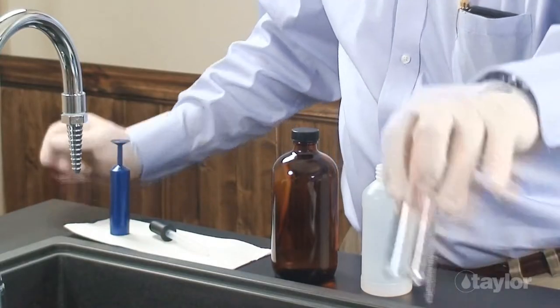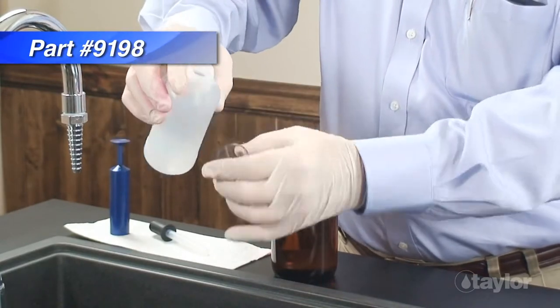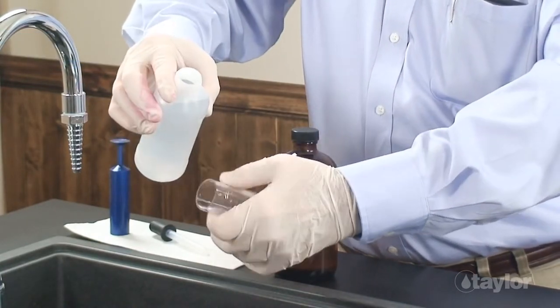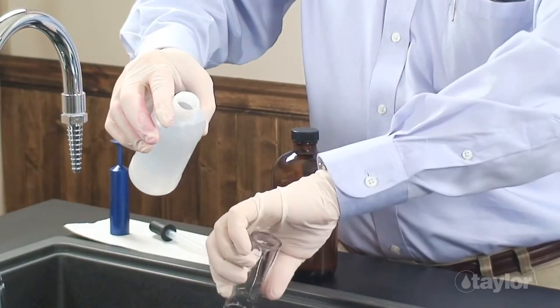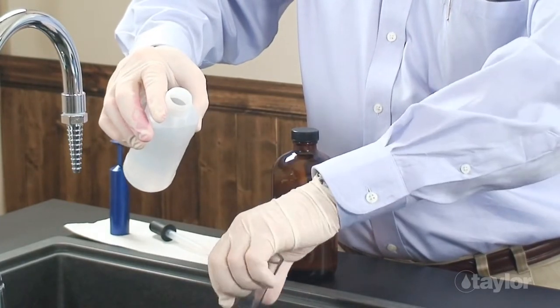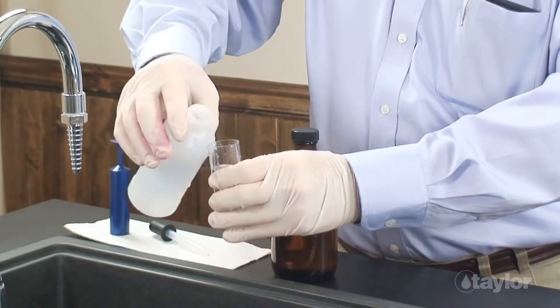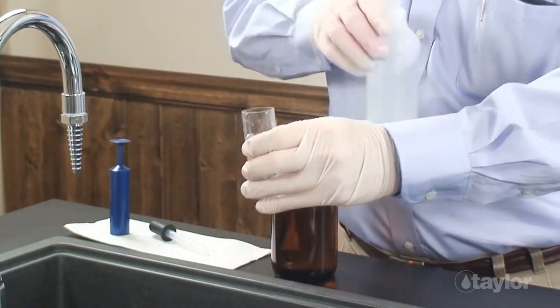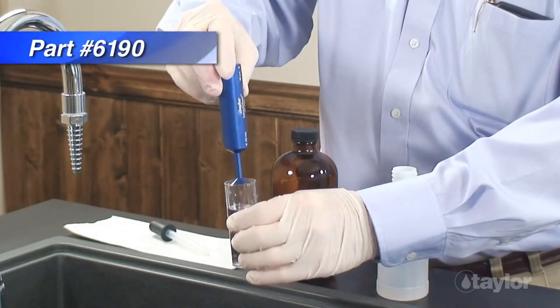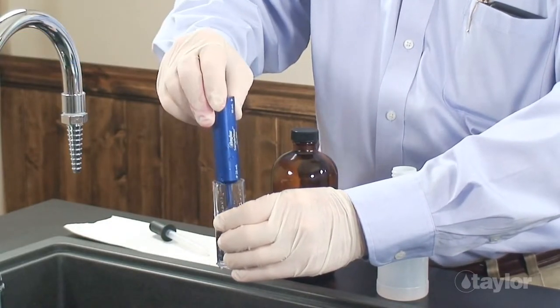Rinse and fill a 25-milliliter sample tube to the 25-milliliter mark with distilled, deionized, or molybdenum-free tap water. Taylor's Sample Sizer, shown here, is a great tool for getting accurate measurements every time.